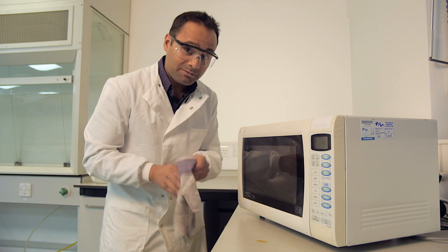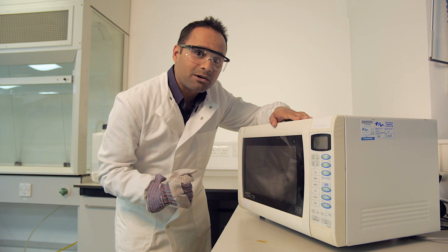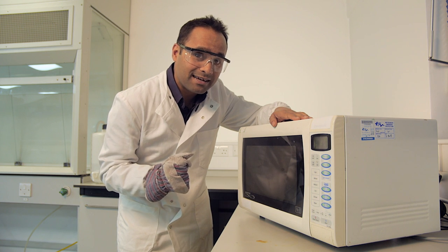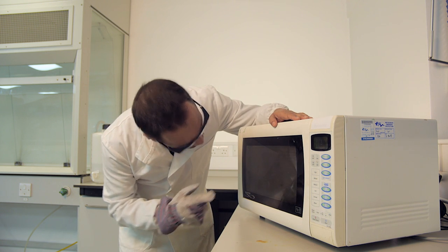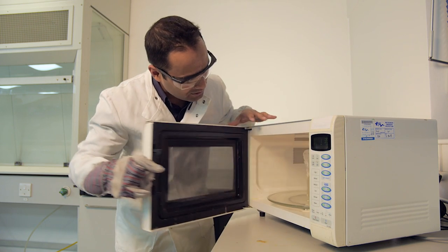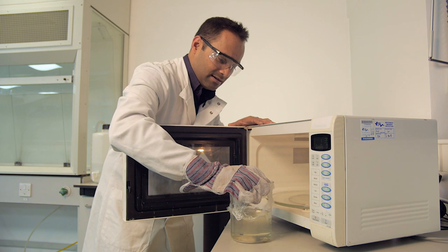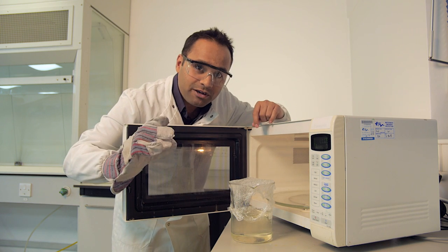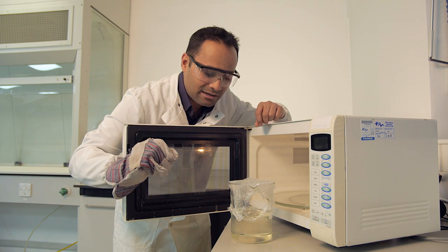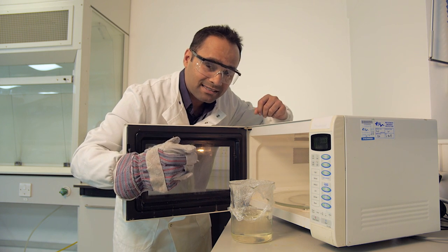So that's nearly there. I'm going to prepare to take it out by putting on some gloves. As with any liquids you're heating in a microwave, it's important to be really careful when handling them. That's boiling away quite vigorously now, so I can stop it just by opening the door. What you're looking for is a nice, perfectly clear solution — if it appears at all oily or gloopy, you need to put it back in to heat up some more.